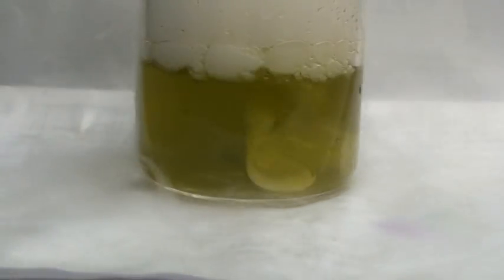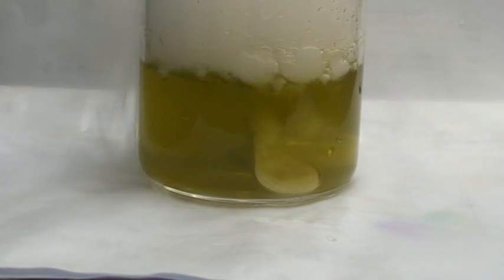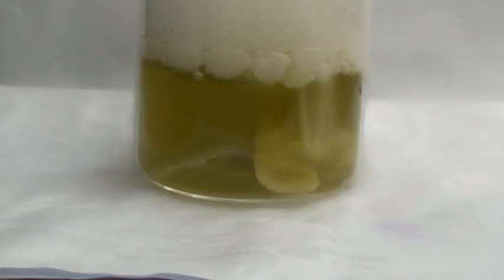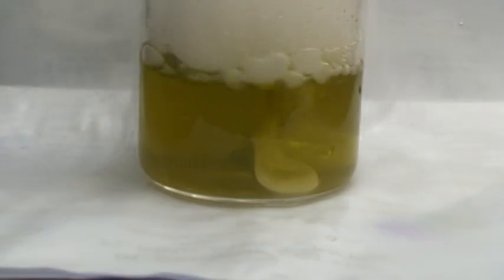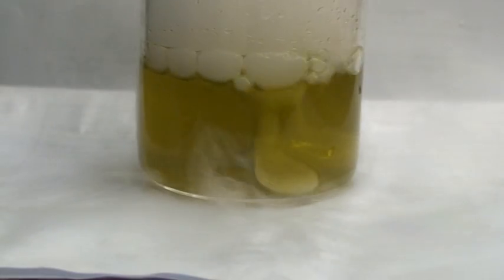And you know what? Just now I played around for a long time. When there's enough ice forming around it, the whole solid carbon dioxide will be lifted up. Because it floats up. So that the net density becomes less than that of water. But solid carbon dioxide has a density greater than that of water. That's why it is sunken.